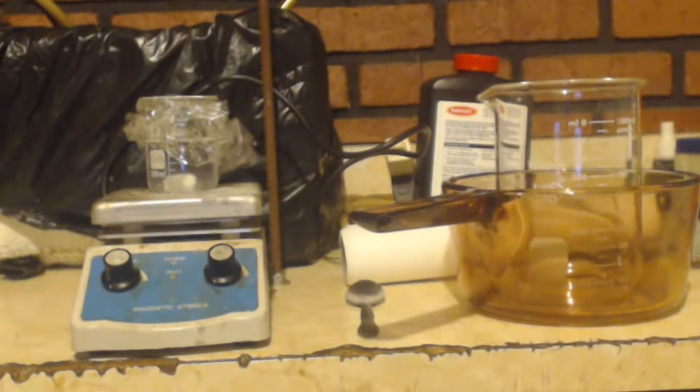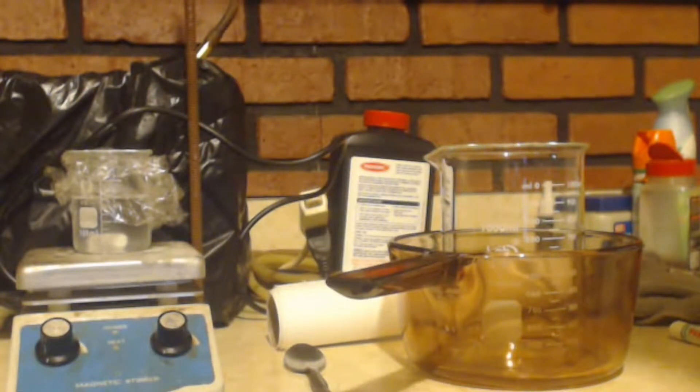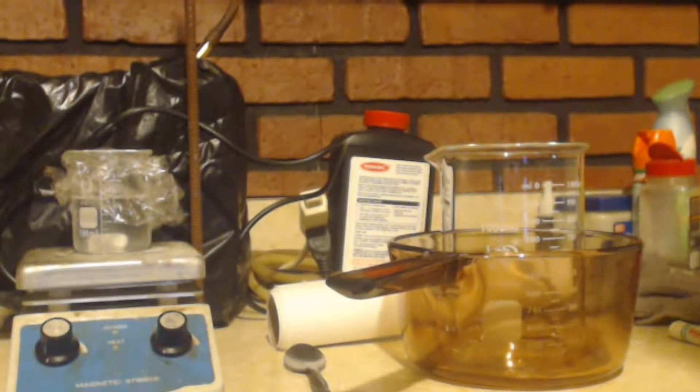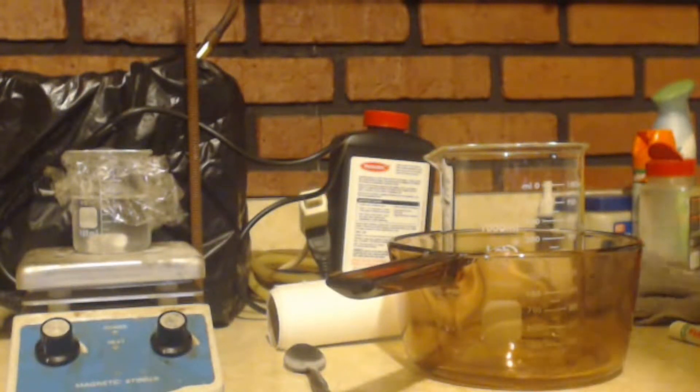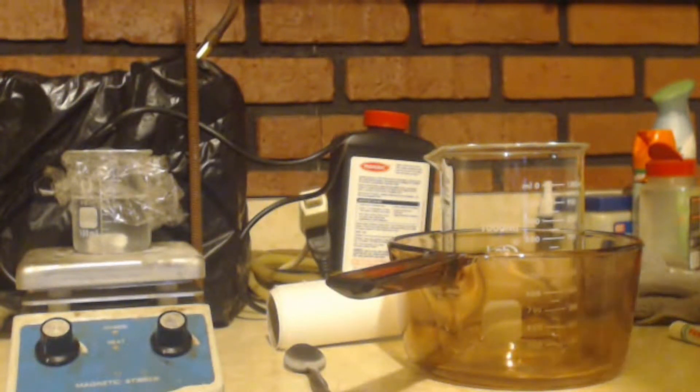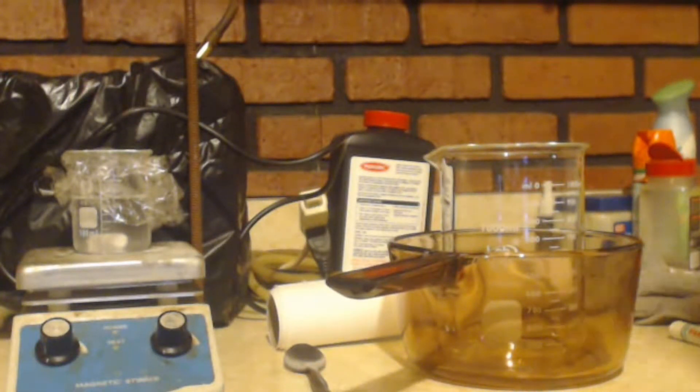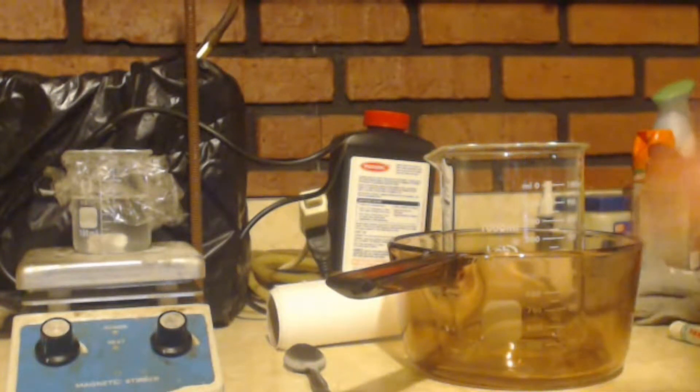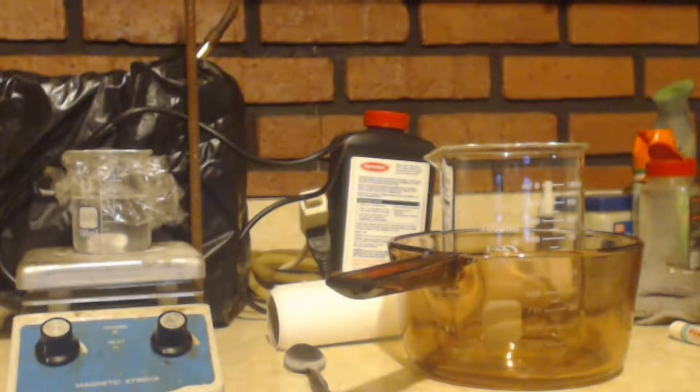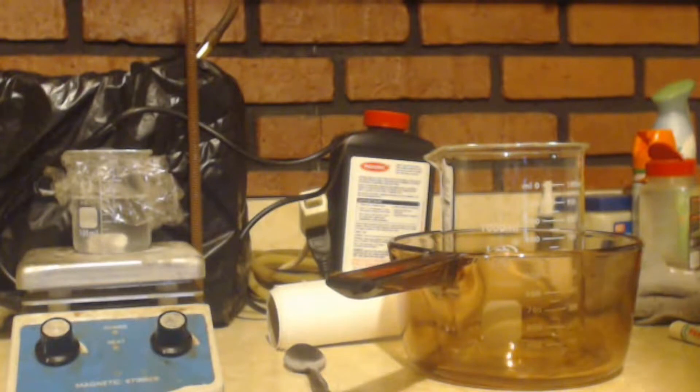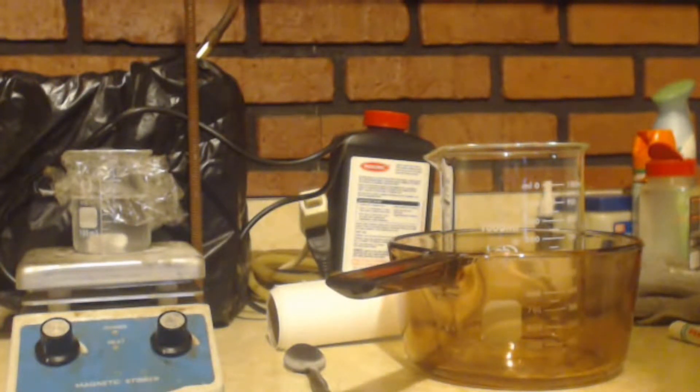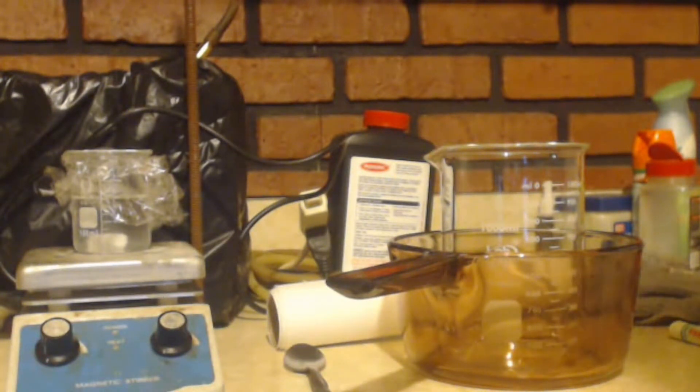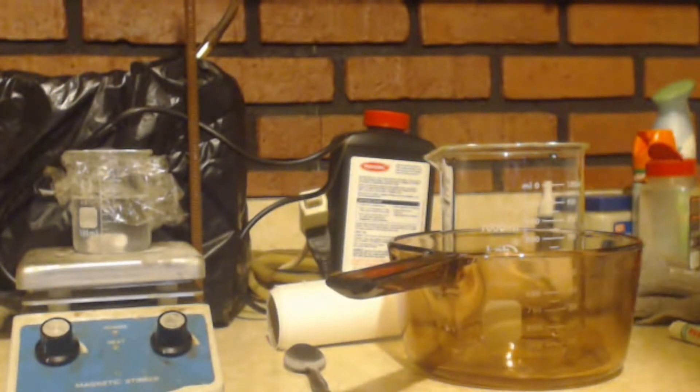This is one of those reactions that is known for blowing up, especially when someone tries to scale it up to make the reaction bigger. For my reaction I might need one bag of ice, but if you double it you don't double the ice, you might need ten times the ice. If you double that again, instead of ten bags you might need a hundred, then a thousand. Who has a hundred or a thousand bags of ice? Keep that in mind. I don't condone anyone doing anything in the video or repeating anything. If you do do anything, do it at your own risk.